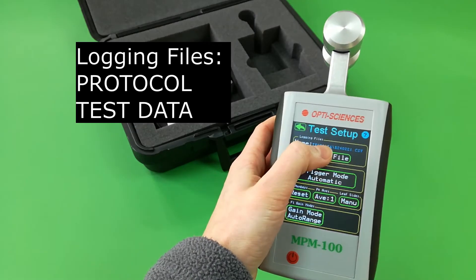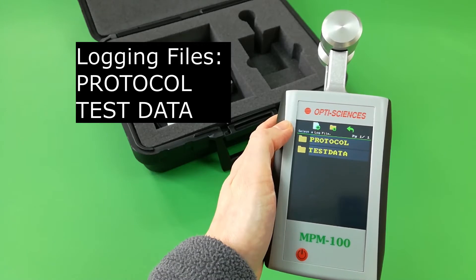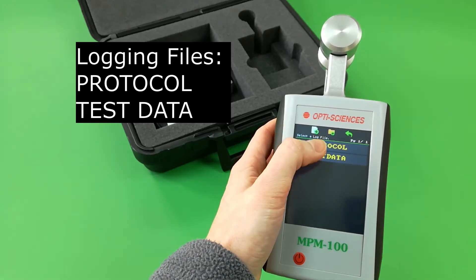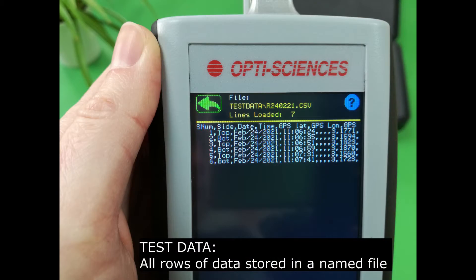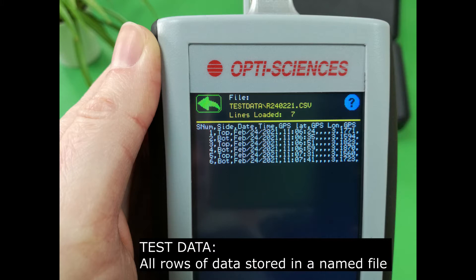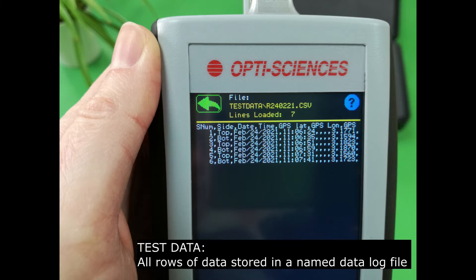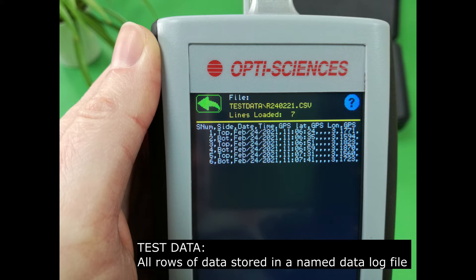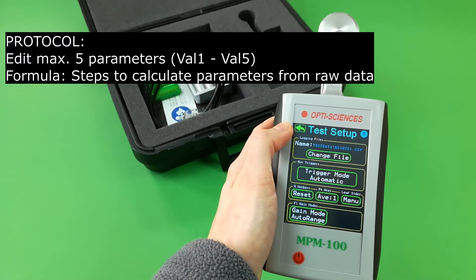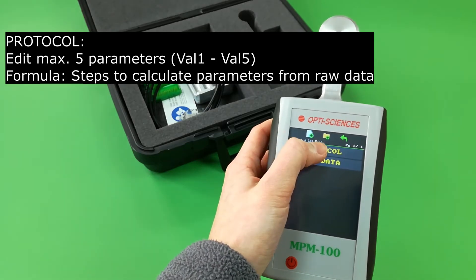Change the data logging file. Both a protocol and a test data file are generated for each set of measurements. The test data records the sample number, leaf side, date, time, and GPS data. The protocol file stores all parameter data.